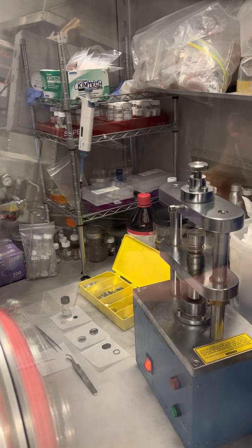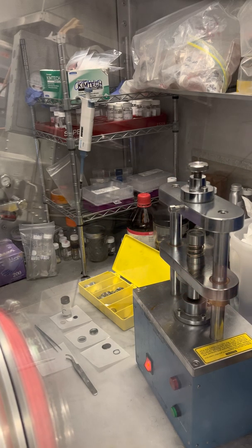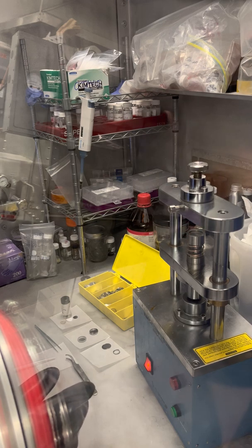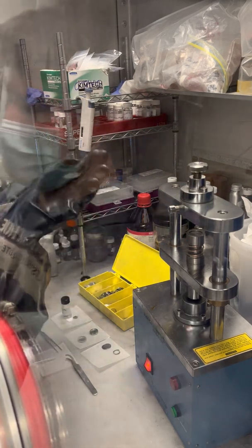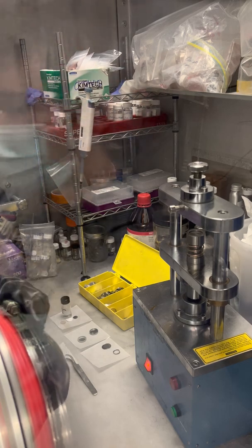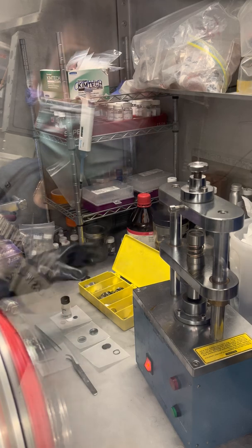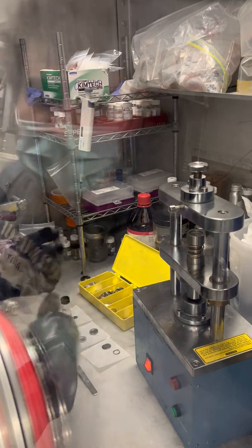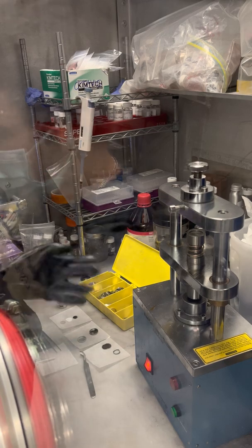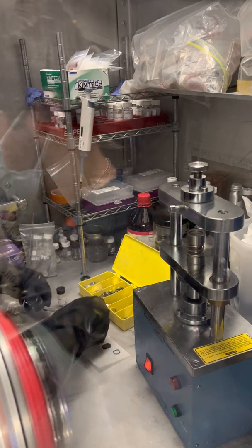We're going to the third and last part of our project. As you can see, we have all the components to prepare the lithium battery already inside the glove box. As we talked previously, this system consists of a positive electrode, a negative electrode, a polymeric membrane or separator, and the electrolyte, which is the medium that the lithium will move inside the cell.